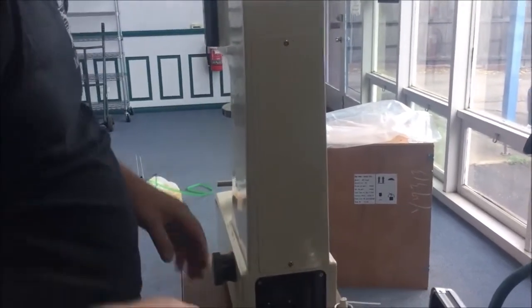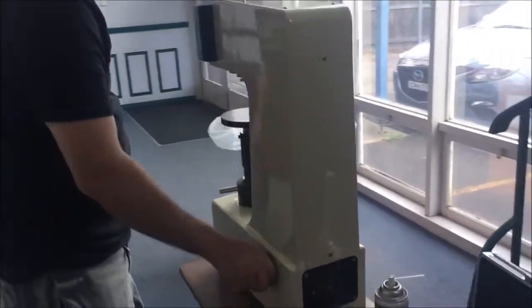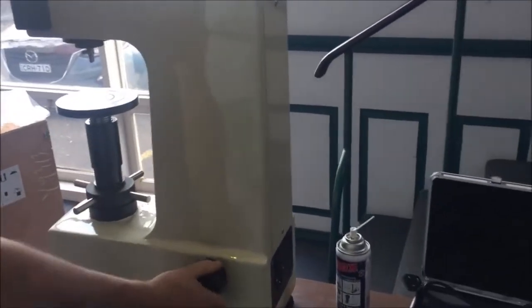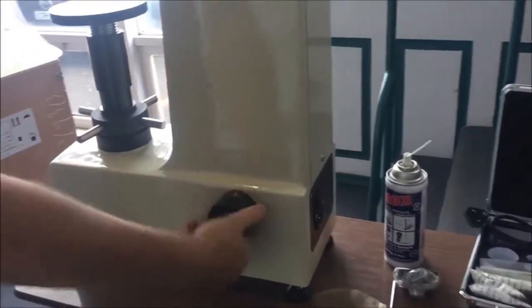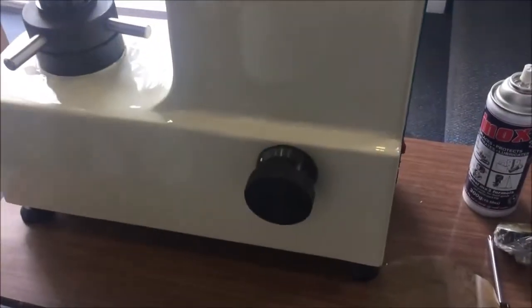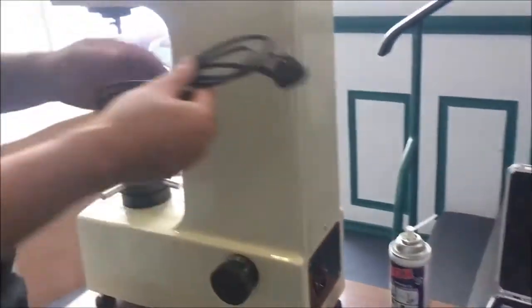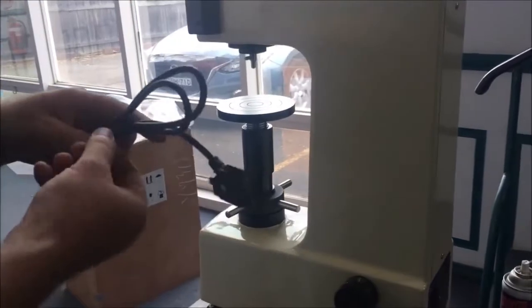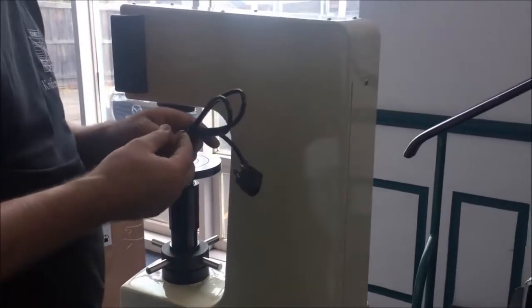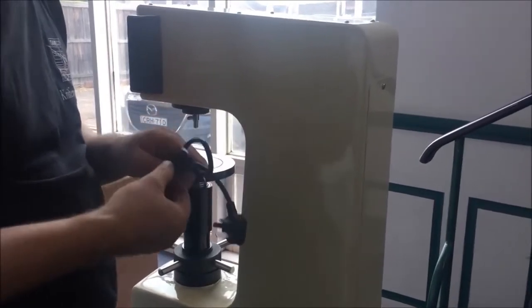For measuring knife blades, we're going to be using Rockwell C scale. So we turn this knob here to 1471. It's got a bunch of different settings and we're going to take 1471. Now, all things being equal, we're right now ready to plug the machine in and do our first test.